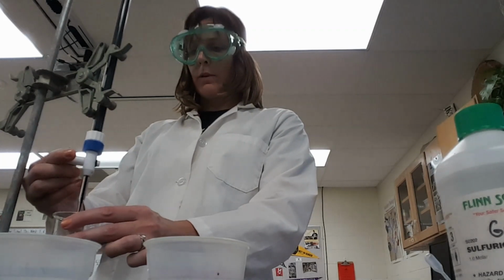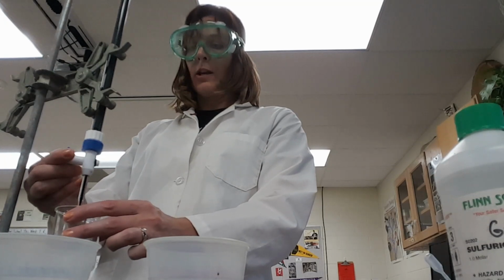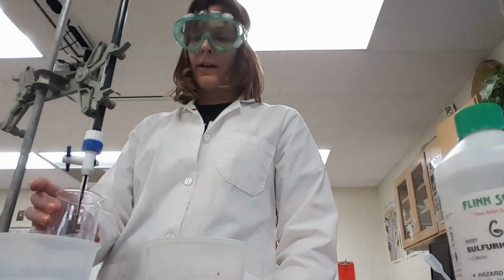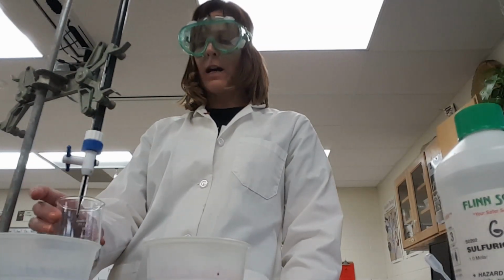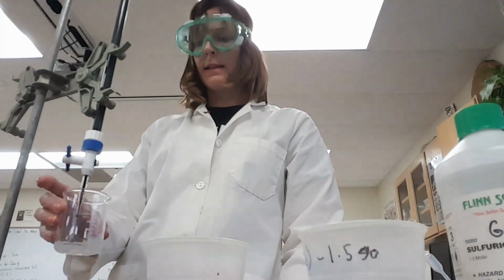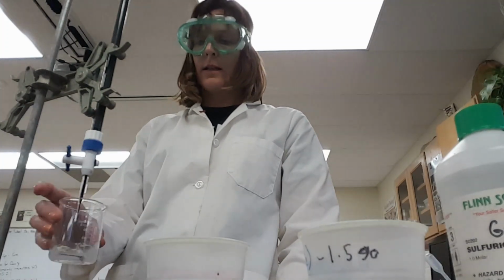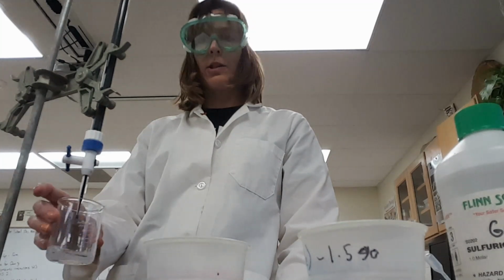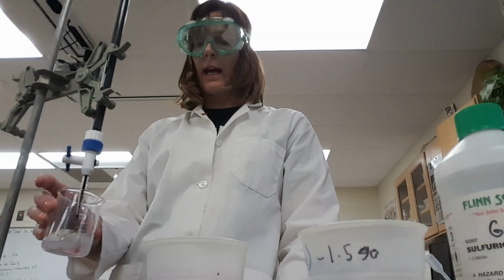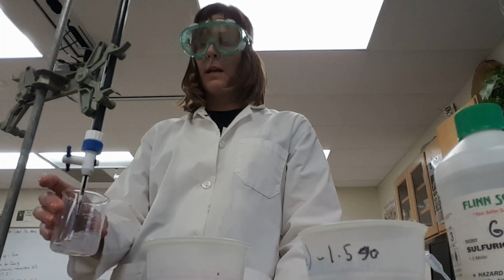Titrations. One of the things you want to try to avoid doing is going past the end point, which is, you want to get to a point where the very last drop, that one more drop added is the final drop that was needed in order to make it stay the pink color. Now this one is going to take a little bit because we do have pretty much hydrogen peroxide in our solution. This was our starting baseline, so it's going to have as much hydrogen peroxide as is possible there. None of it has been broken down by enzymes.